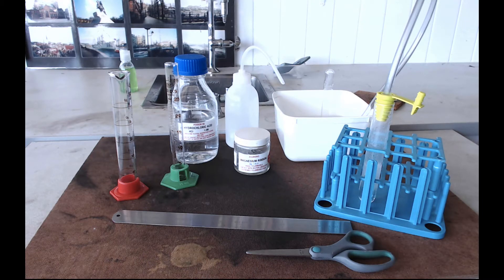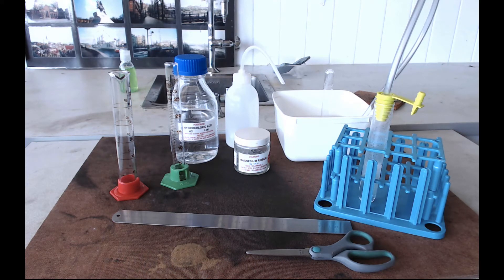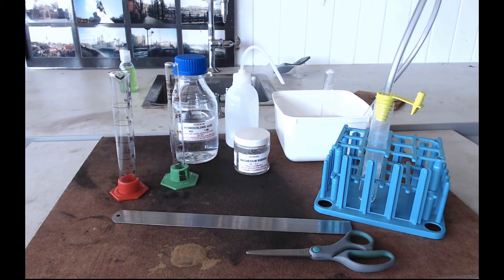And in an investigation, you'd obviously want to have five data points. So if you want, you can try 5 milliliters of acid with 15 milliliters of water. But I don't know if you'll have time to do that. So certainly, we're not going to collect all five data points, but you could aim to get about four here. As a minimum, we want to try and get two done, so that we can see what happens to how fast this gas collects when we change the concentration of the acid.